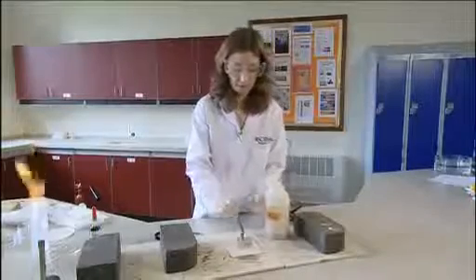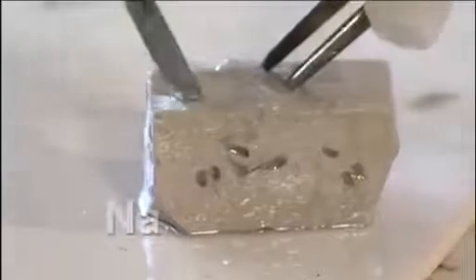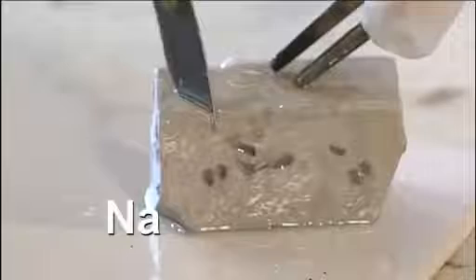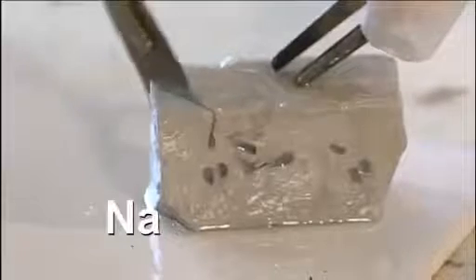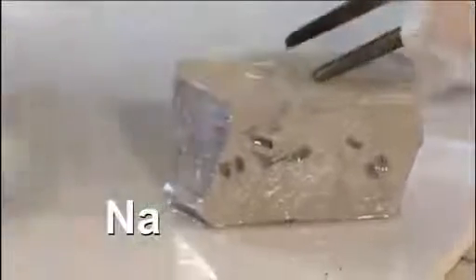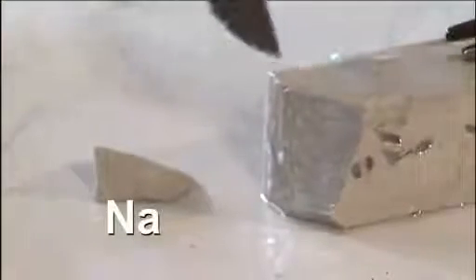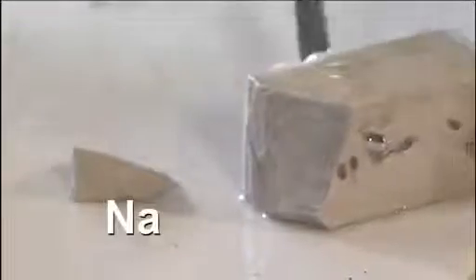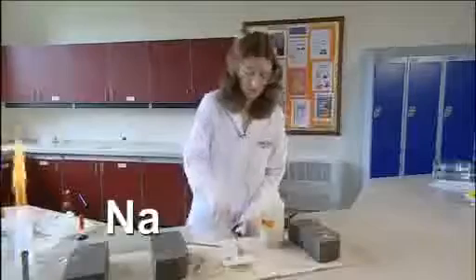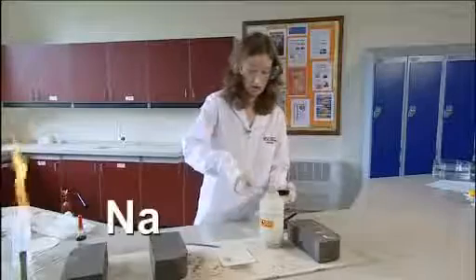Okay, so we need to cut a piece of sodium off this large piece. And you can see the lovely shiny silver surface that tarnishes much quicker than the lithium in air. Put that large chunk back in the oil.